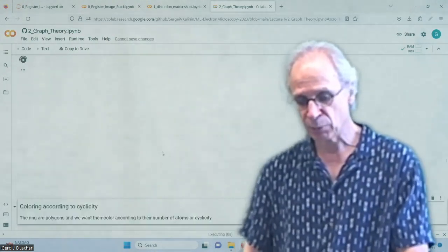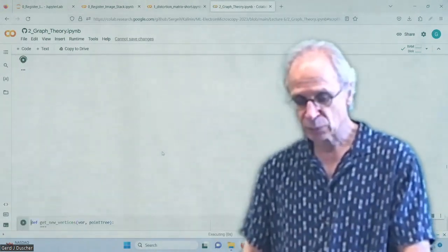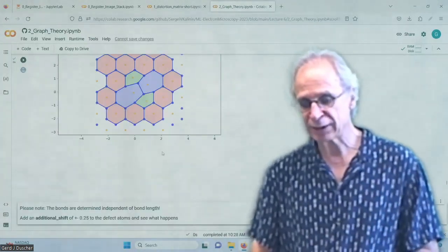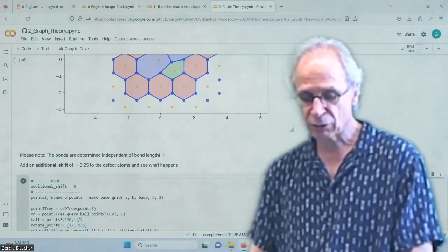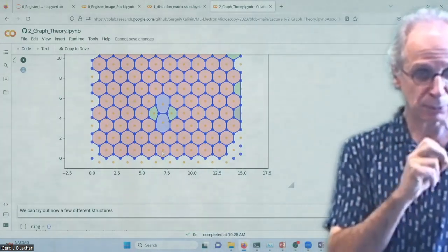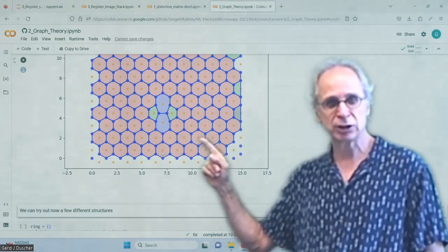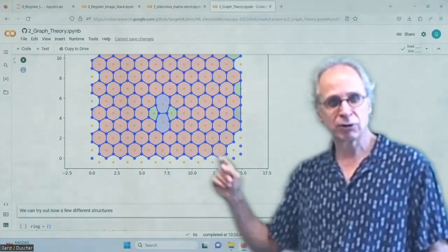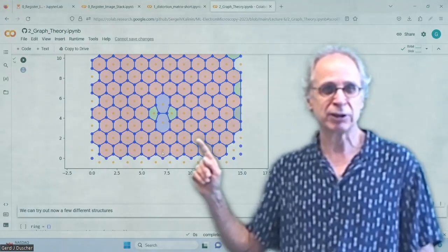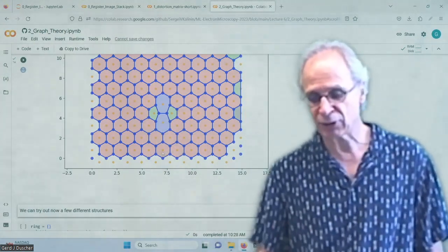Okay. We plot them together, right? And then we plot them according to the rings. And let's do that all in one nice thing here. And look a little bit more into how stable this method is, right? I mean, for a honeycomb kind of pattern, obviously the positioning is quite easy. Also, if I have slight distortions, which I have minimized before, I get that very accurately. They are very close together, and I probably don't have a lot of problems with that. The defects are a different matter, so I want to have those very accurately.